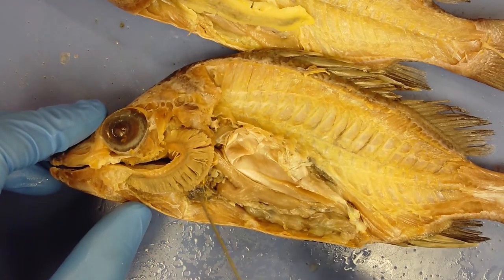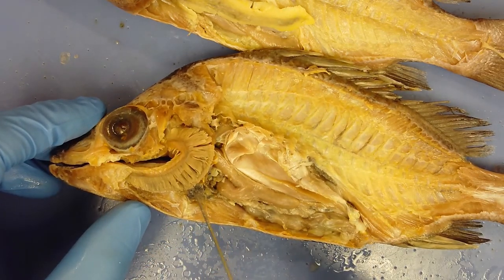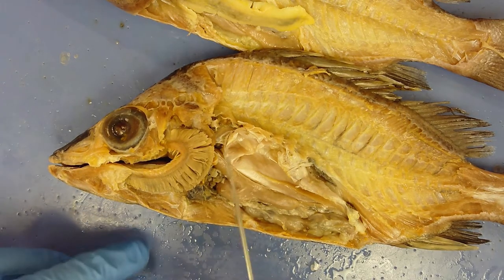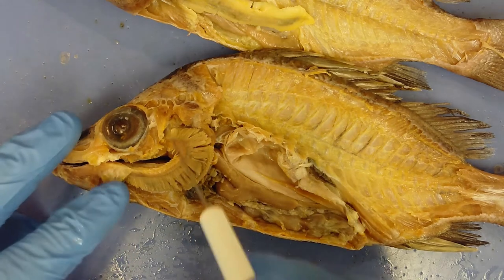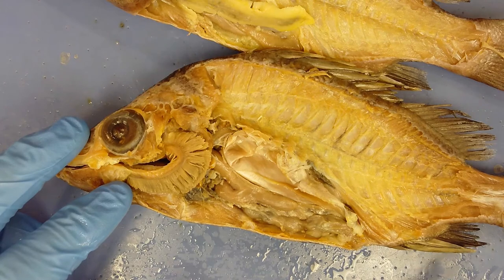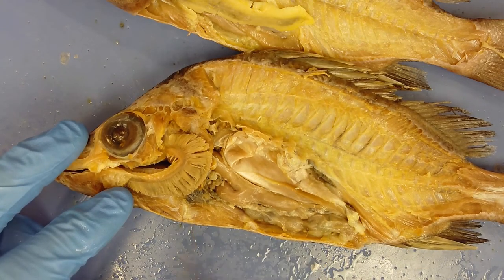The heart is this dark black structure, which pumps blood to the gills where it becomes oxygenated, releasing CO2 and ammonia. It then flows up the length of the body, runs down an artery, comes back through a vein, and the cycle repeats.